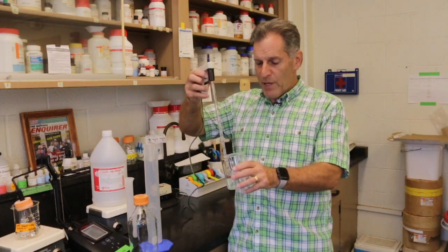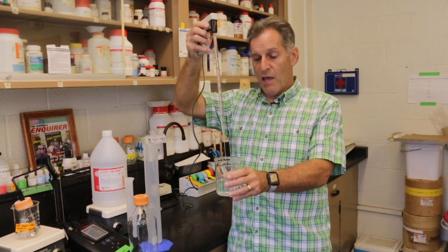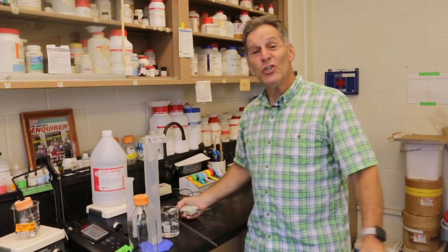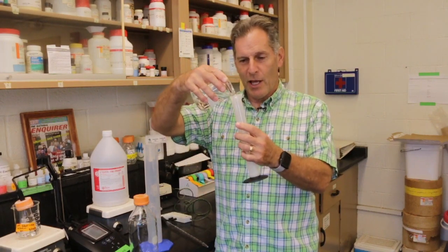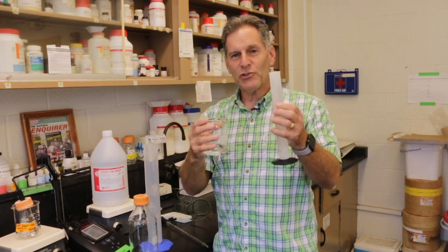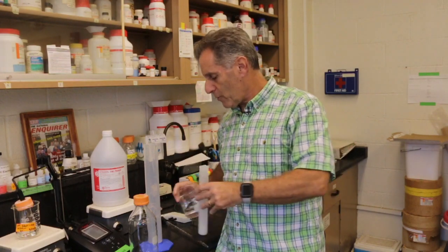So if I measure out 10 milliliters of water, I can tell you exactly that 10 milliliters of water is going to weigh 10 grams. I'm not a magician, I'm not a genius, that's just how the system is. And if I measure out 100 milliliters of water, guess how much it weighs? It weighs exactly 100 grams.